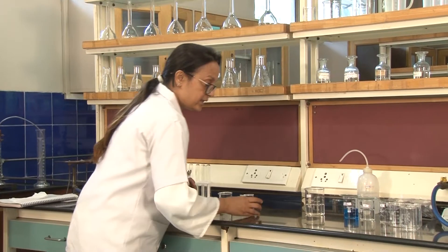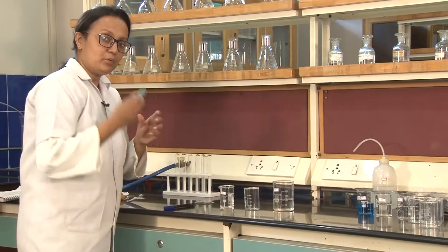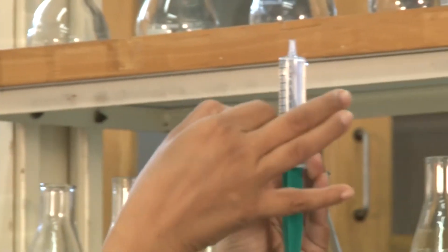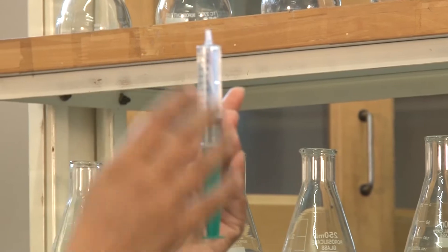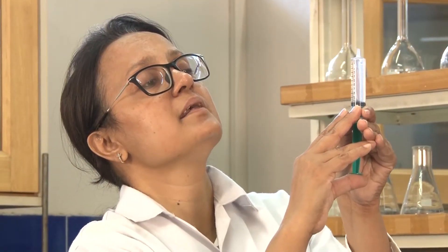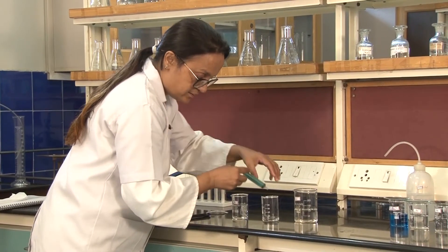We're taking this beaker, a syringe, and distilled water. I'm going to take 10 ml of G, which is glucose. There could be air bubbles in the syringe, so a little tap would help release them. It's very important to be mindful about the volume — the upper line of the rubber should align with the measurement. Push the plunger in — this is 10 ml. We now pour this 10 ml into the first beaker.